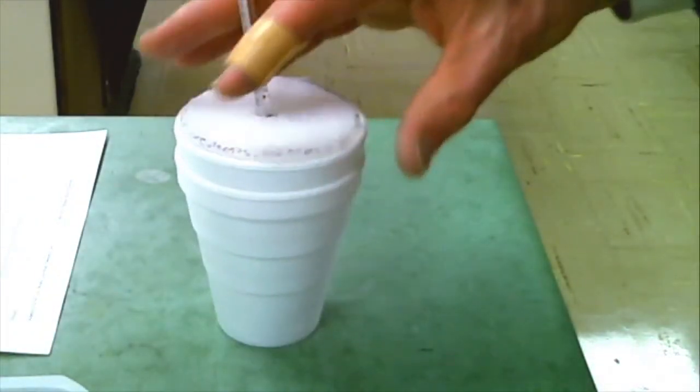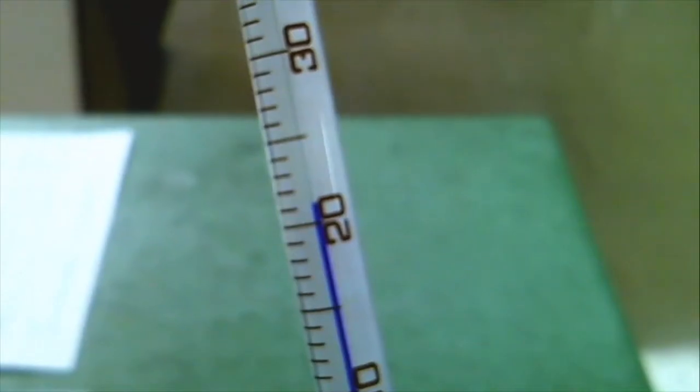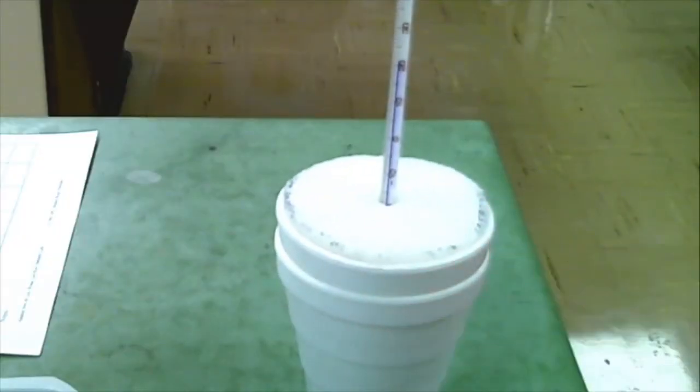I think it's been in there long enough to equilibrate. I call it 21.0.